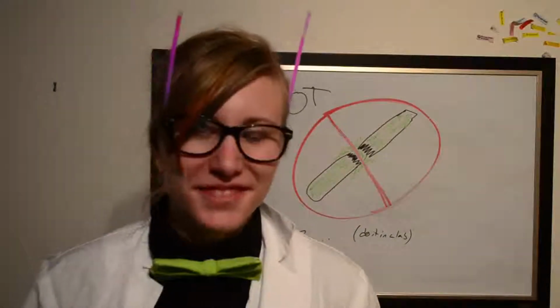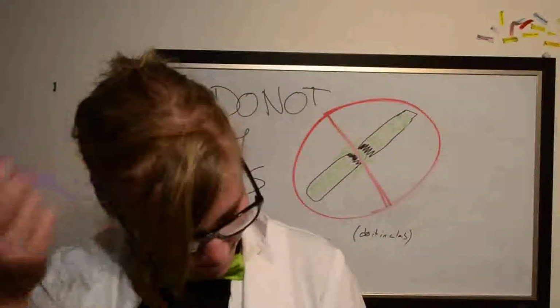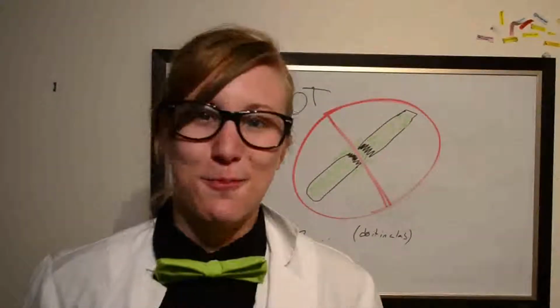My mom is gonna kill me. Oh crap. So we all have our special moments, and apparently that was mine.